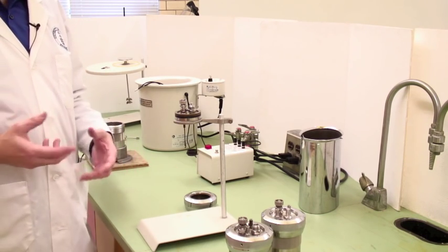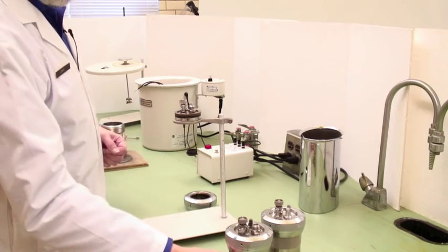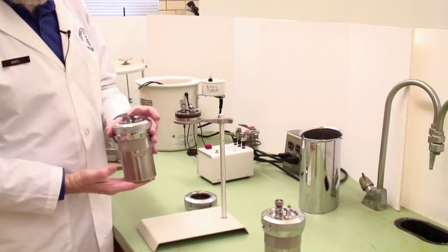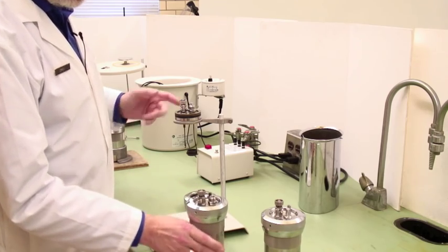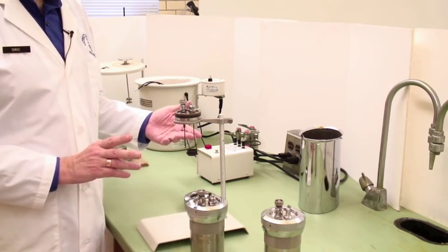This video explains how to use an oxygen bomb calorimeter. This is a bomb calorimeter here, this is actually the bomb head inside and we'll be explaining how that works.